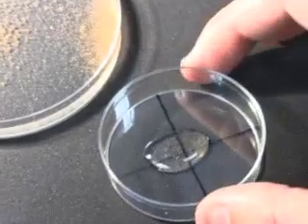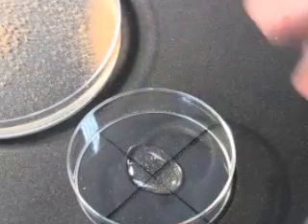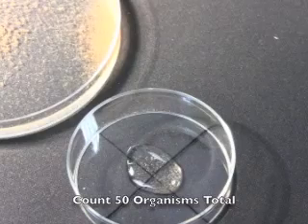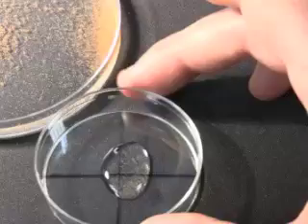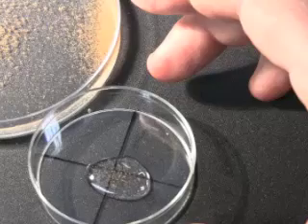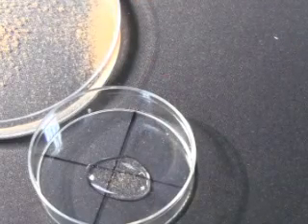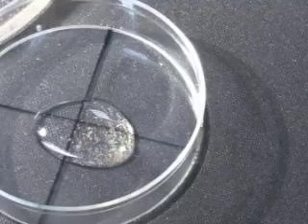To achieve statistical significance, you really need to count a total — that is alive plus dead — of 50 organisms. You'll be able to tell fairly reasonably by just eyeballing that. You could put them on the dissection microscope and have a look. If you haven't got enough, come back and get an extra one milliliter of the treatment group and then you can count.